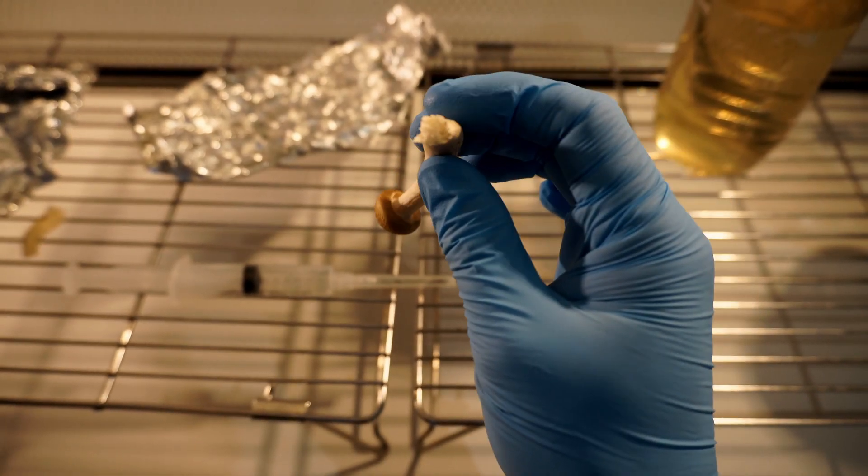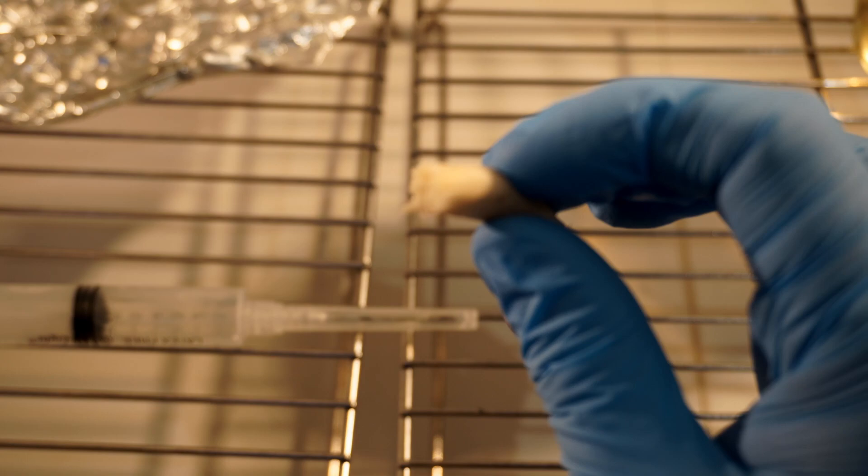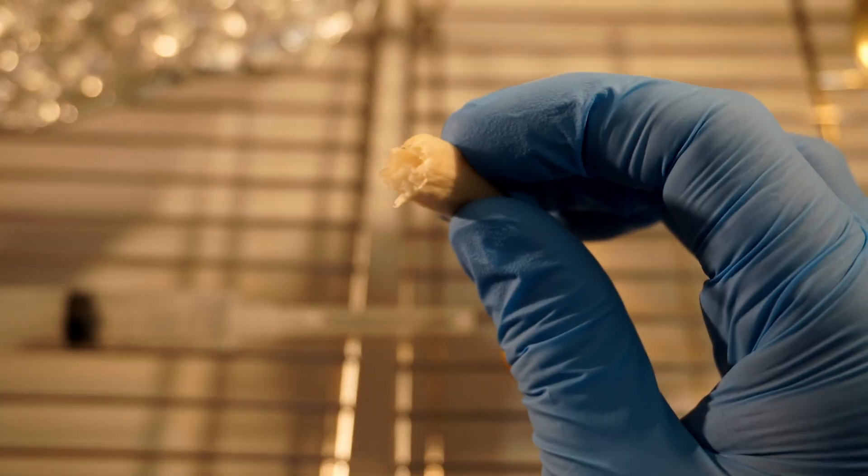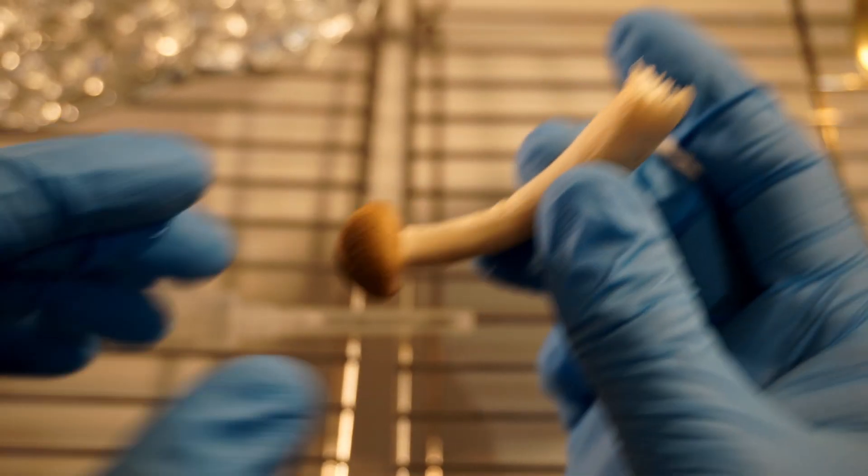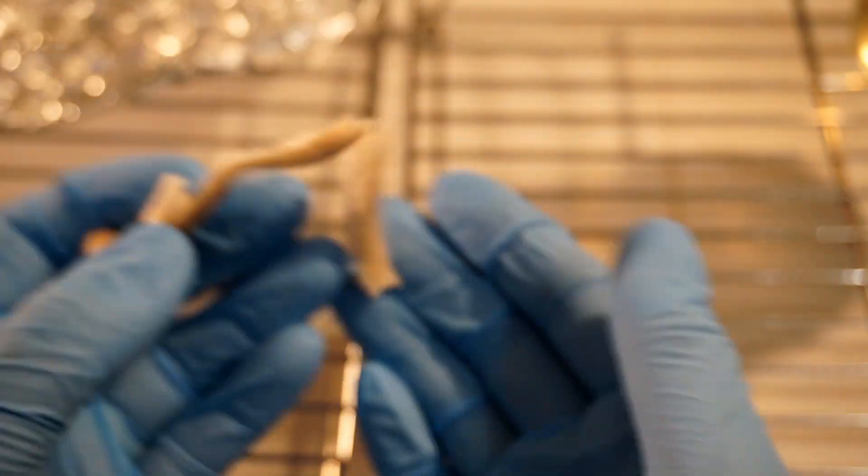When you tear the stem you want to make sure that you pull. Don't twist it and don't bend it or else you risk breaking through the whole stem. Here you can see I do it incorrectly and then in the next clip I'm going to show you how to do it correctly.